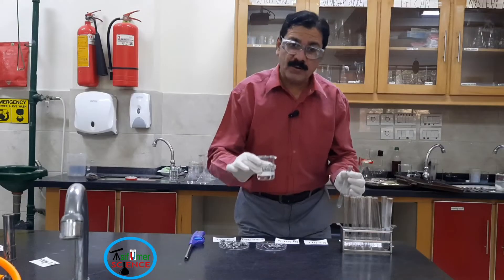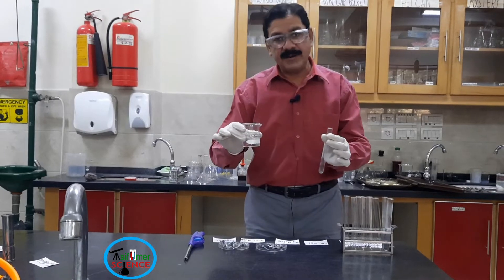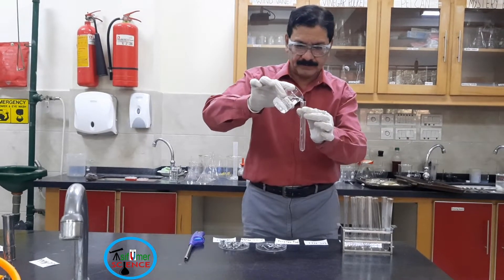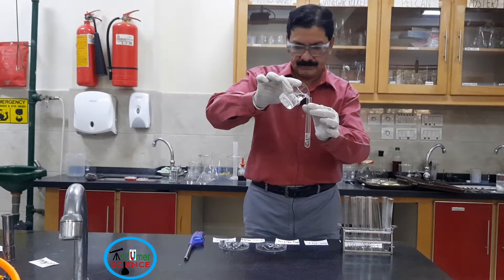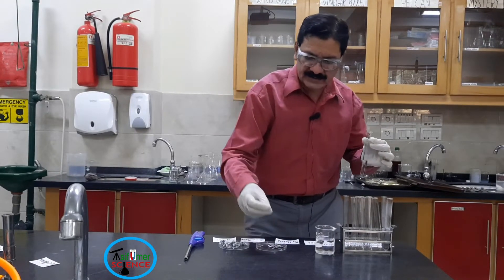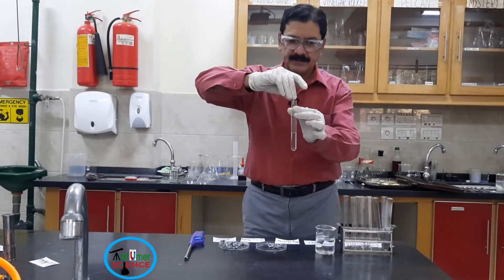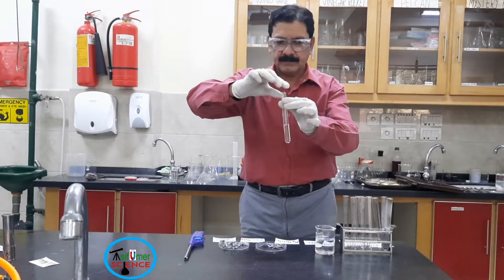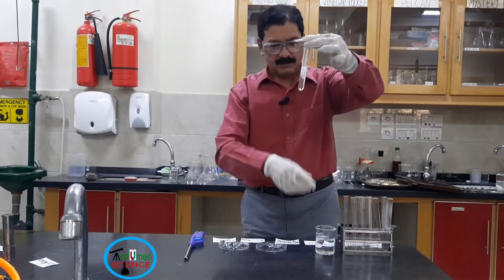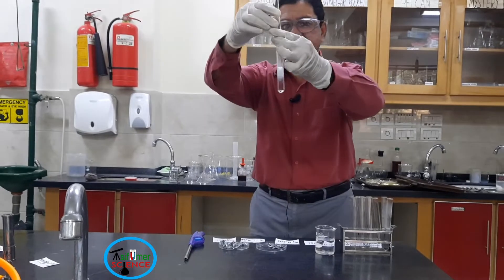Now I am going to pour approximately 10 ml of dilute HCl in the test tube. I am going to add a small piece of magnesium ribbon. You can see bubbles are produced — a very fast reaction.